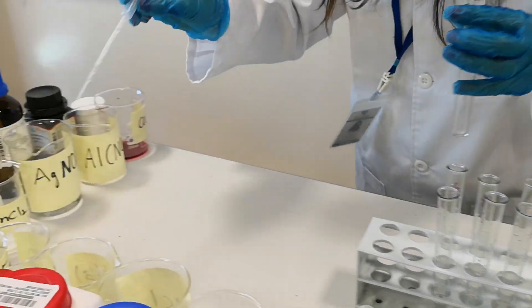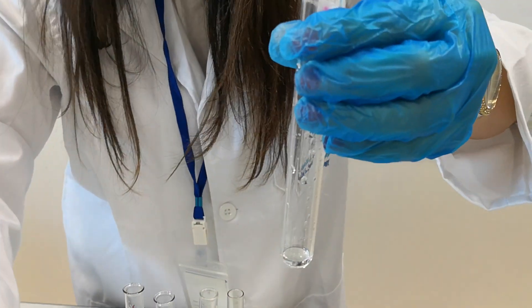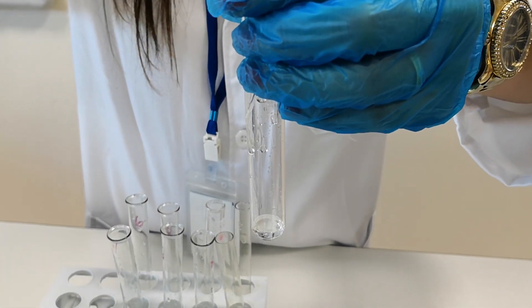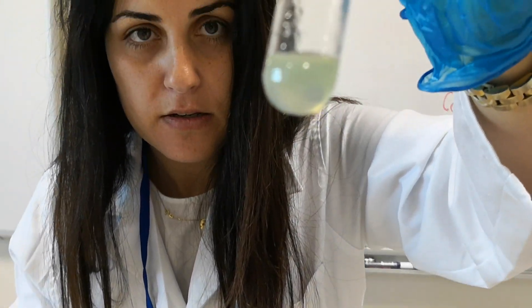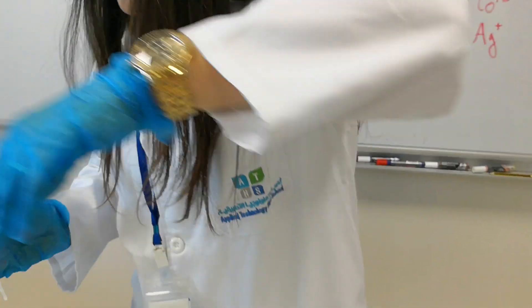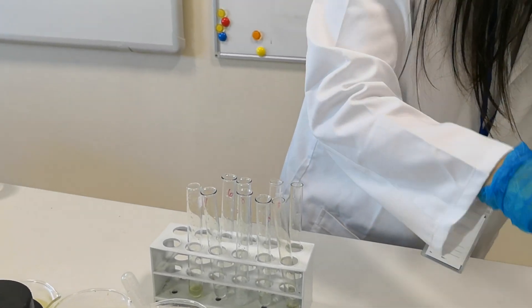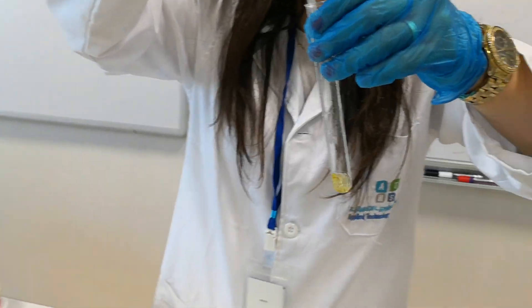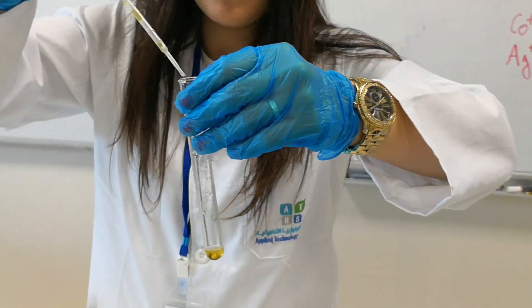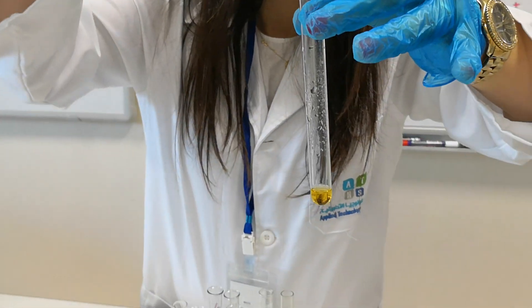Now let's try iron. This is a solution of iron(II), Fe²⁺. Adding drops of sodium hydroxide — it's green. Whereas iron(III) gives a brown color. The iron(III) solution already has a color, but when I add sodium hydroxide it becomes a dark brown precipitate.